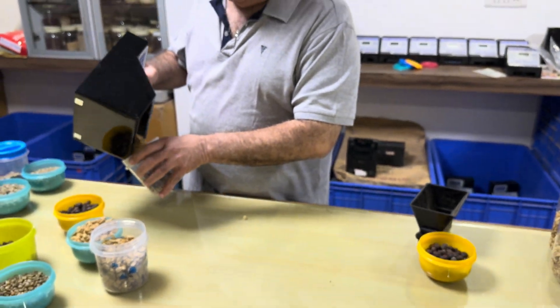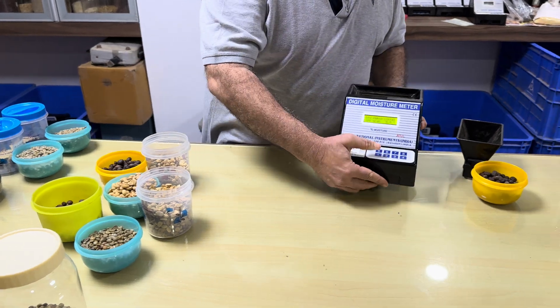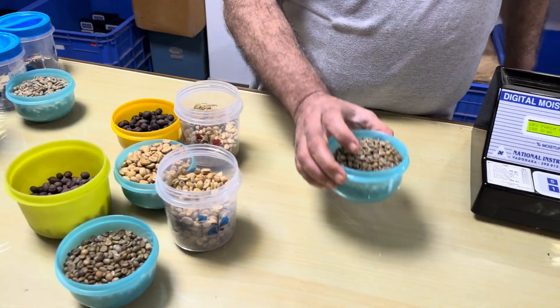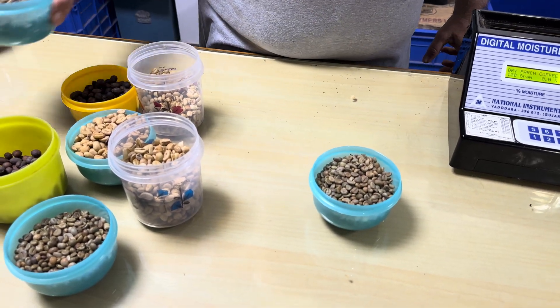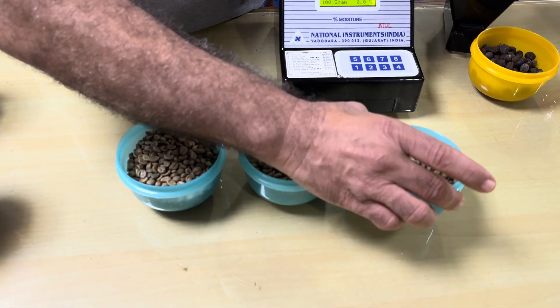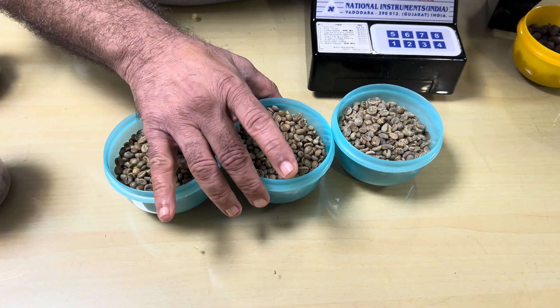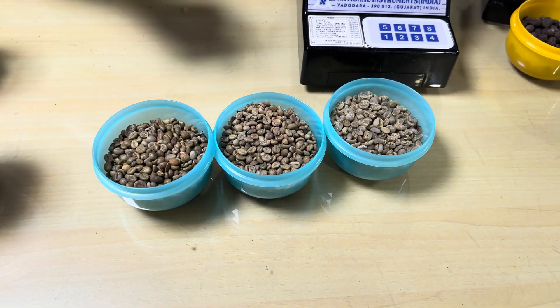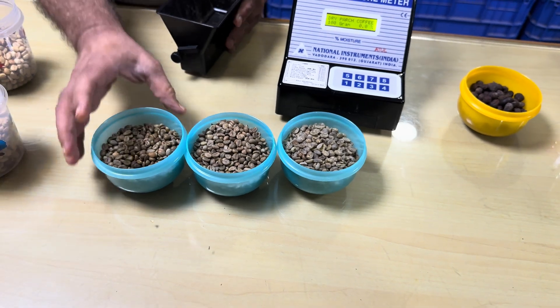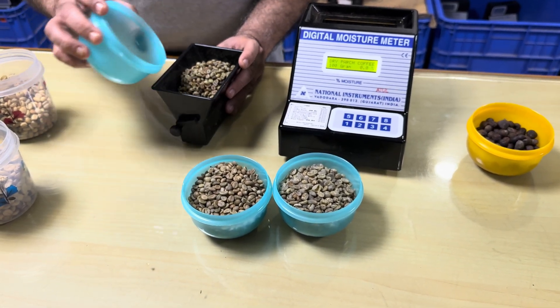Now the final form of coffee, which is sold as coffee seeds — we have 3 samples: 1, 2, and 3. I think this one is Robusta, this is Arabica, and this is also Arabica. I will show you the moisture contained in all 3.